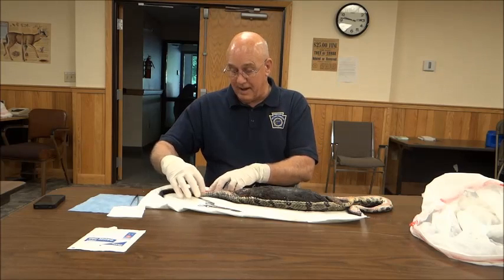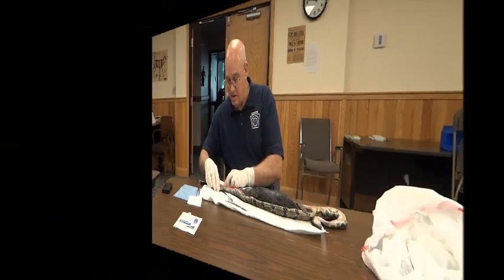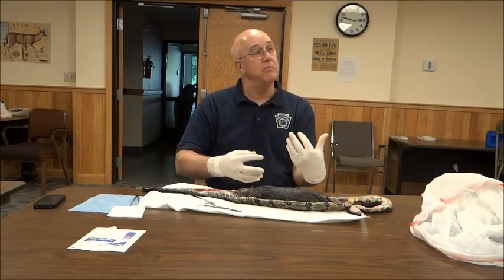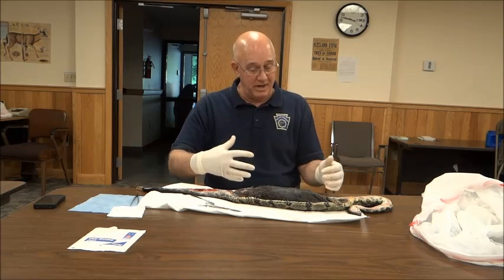There's no problem back in here. Everything looks normal. It's hard to say when he was swallowing that whether the claws were turned right or were they ripping the whole way down. Stretched so tight.